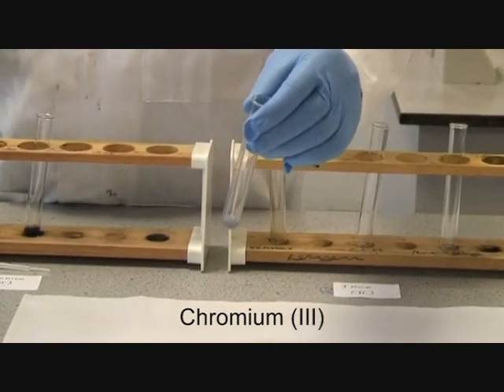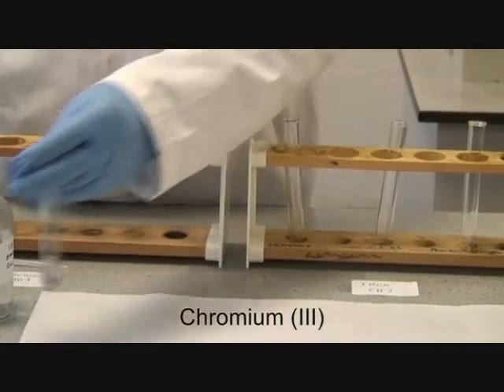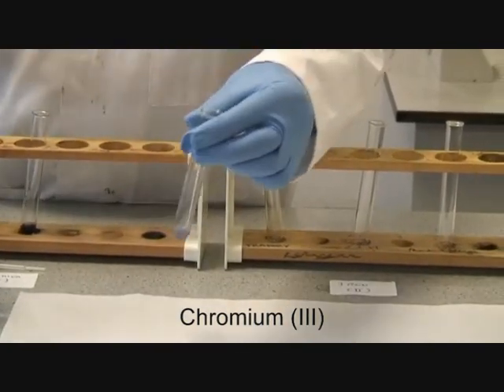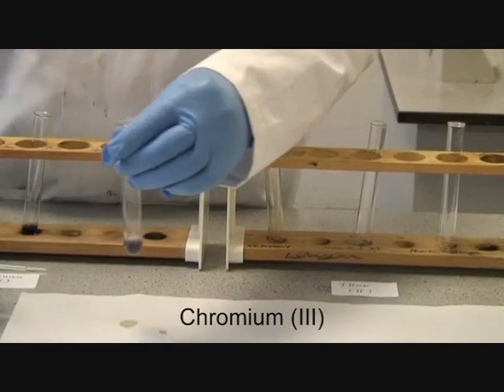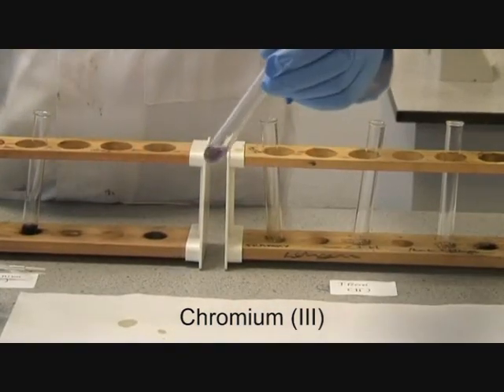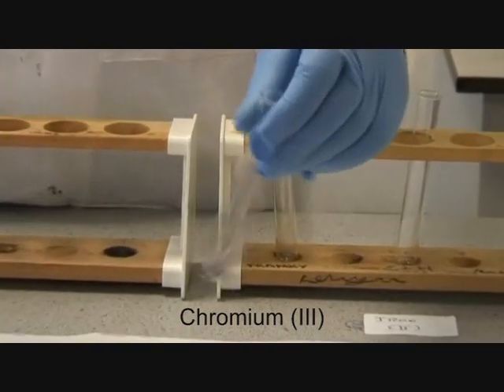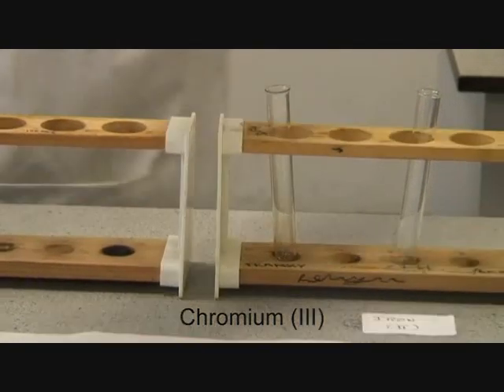If we add a more concentrated solution of this, the effect should be that it clarifies. As you can see, this has happened. You end up with a clear solution. Just try and identify this species.